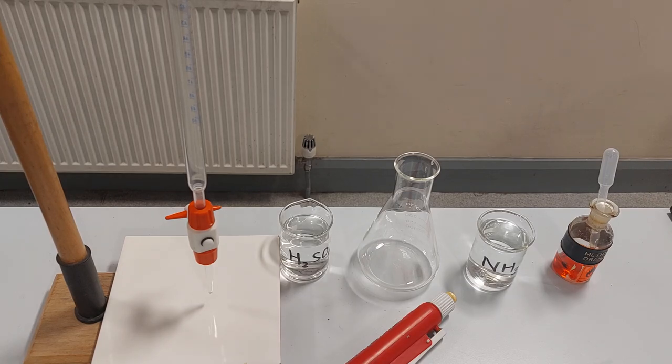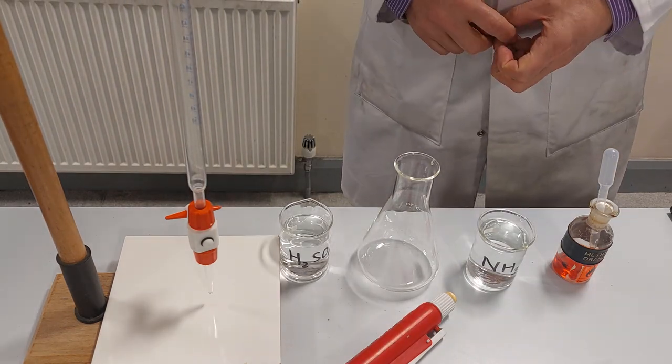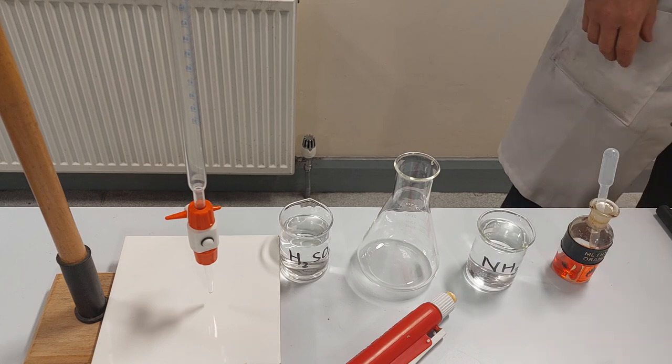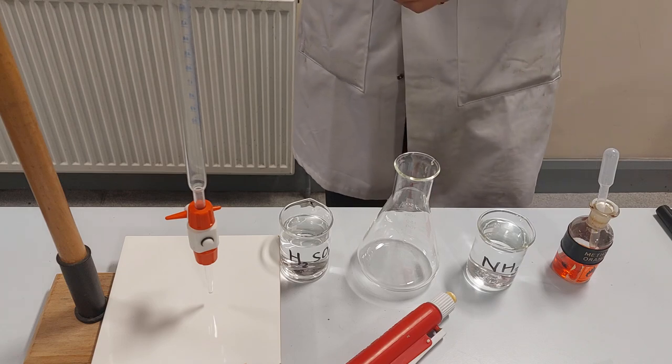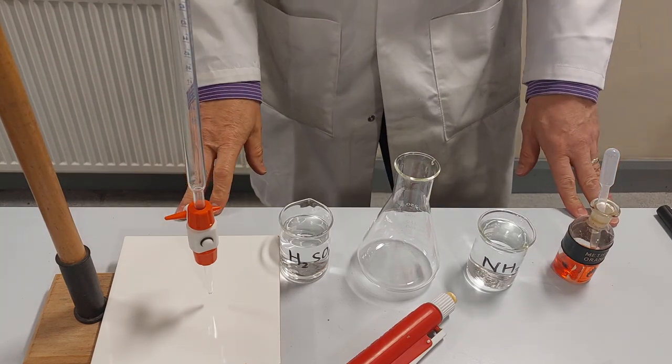Hello and welcome to a special edition of this YouTube series. We're going to be looking at making fertilizers in the lab today. I thought it would just be good to have a look at the process of titration.